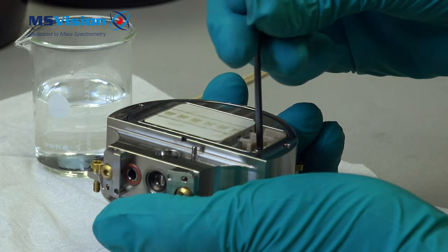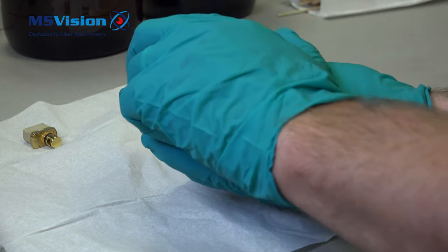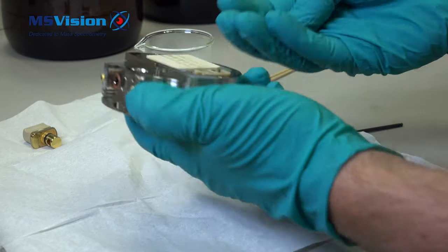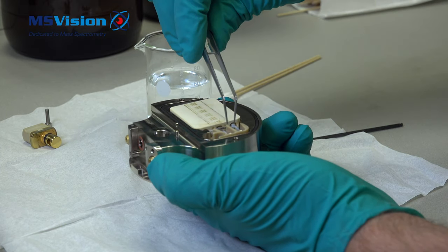The heater we can take out by removing just one screw and then hold it upside down. The wires can break so be careful not to bend. Here we use tweezers to be careful.